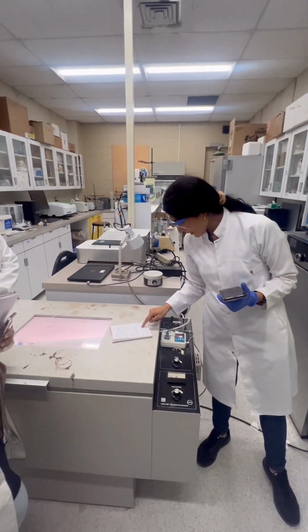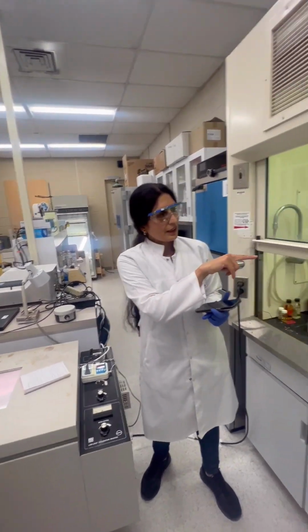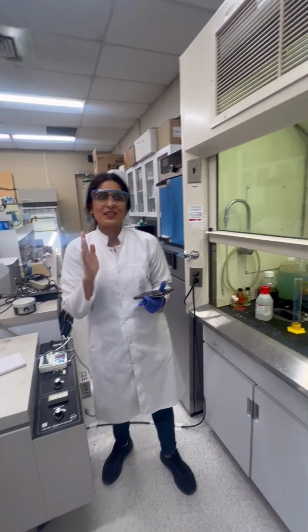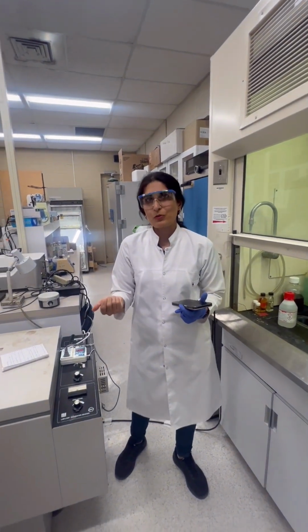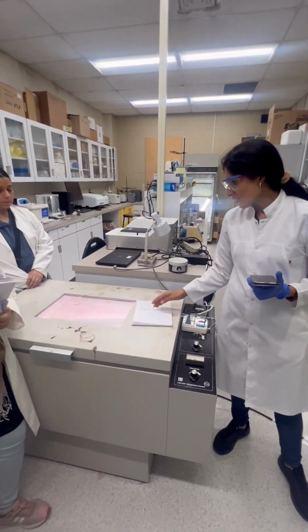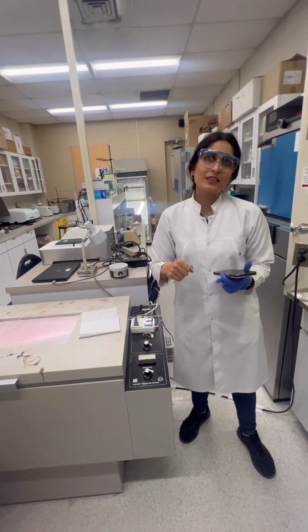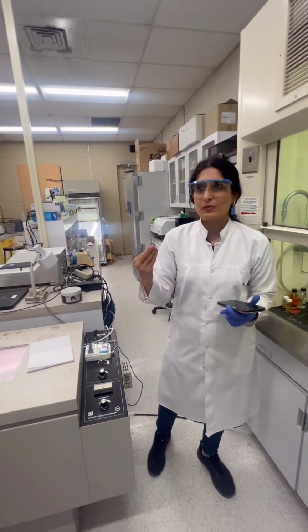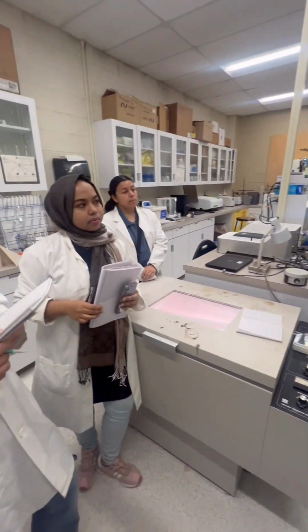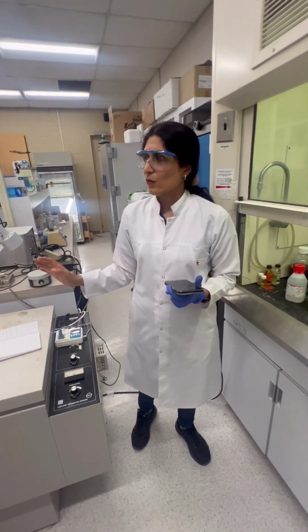No, sorry. After 6 hours, we need to eliminate excess potassium permanganate by adding around 700 microliter of hydrogen peroxide. And after that, we need to wash it with a mixture of 10 milliliter HCl and 30 milliliter DI water. It means 25% HCl and 75% DI water.